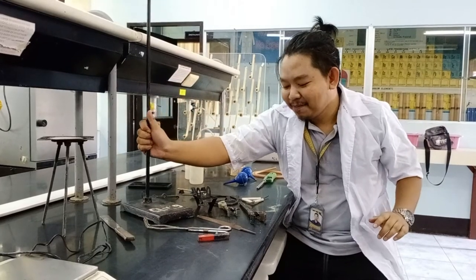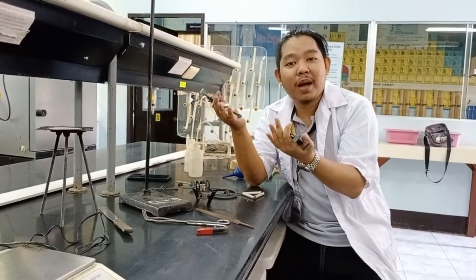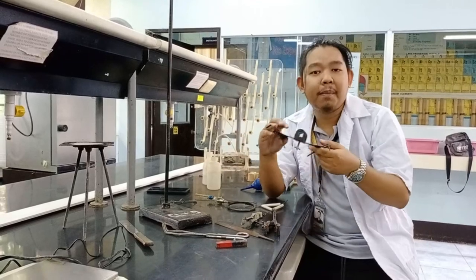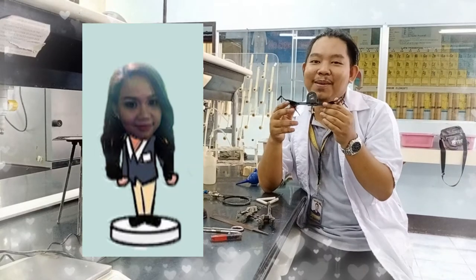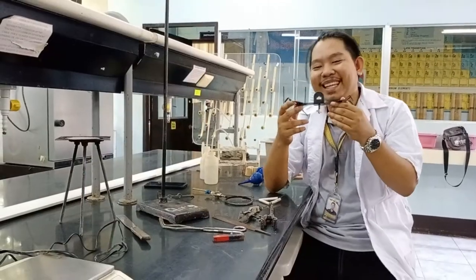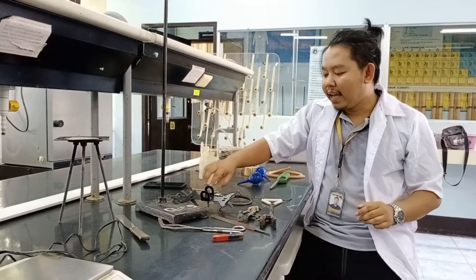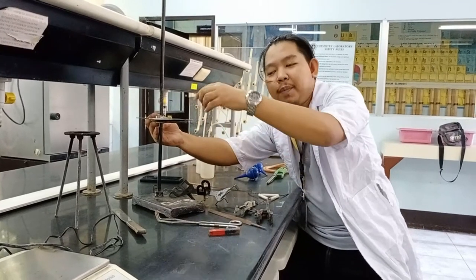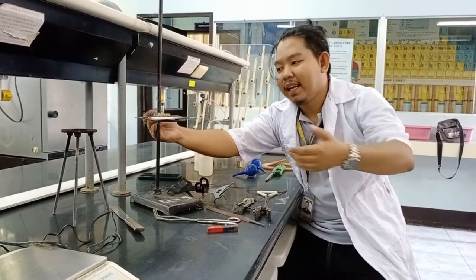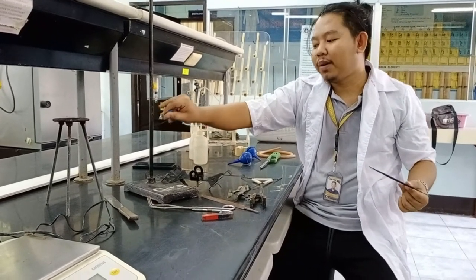So, the iron stand. Then we place our utility clamp and iron clamp on it. During the distillation process, I'll show you how to set this up. We have the burette clamp as well. You're familiar with this because we sketched it — you have the clay triangle. And the iron ring — your evaporating dish can be placed here. In the later part of our sessions, I'll show you how to evaporate some liquid.